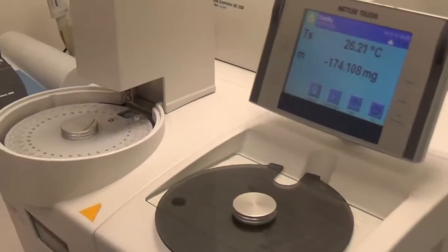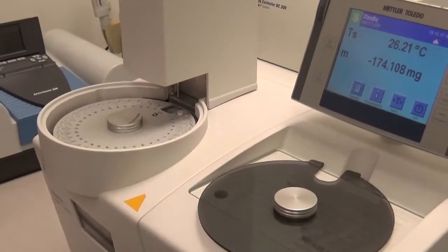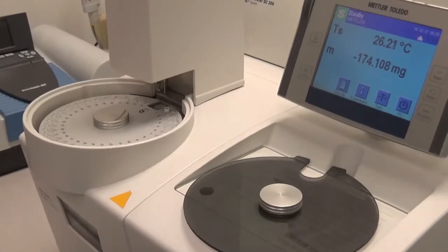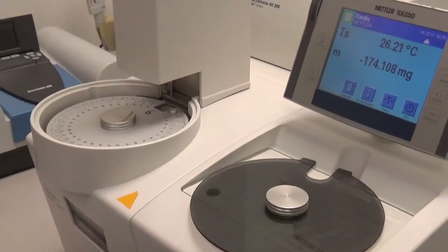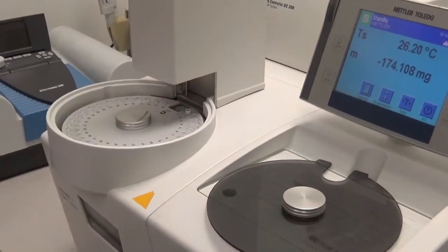Once we say okay, it picks up the crucible and the sample — again the furnace opens.